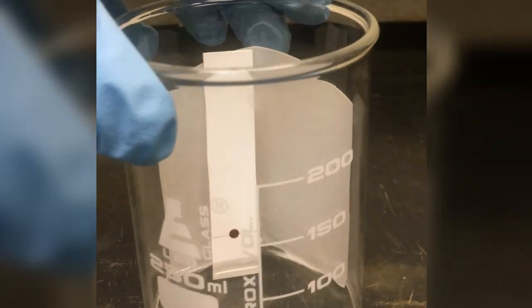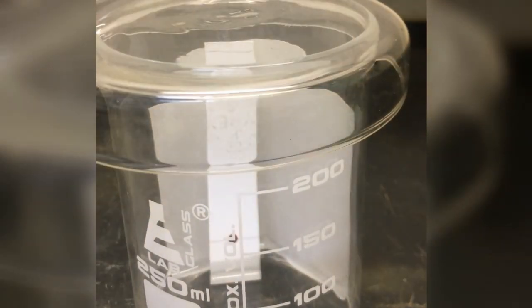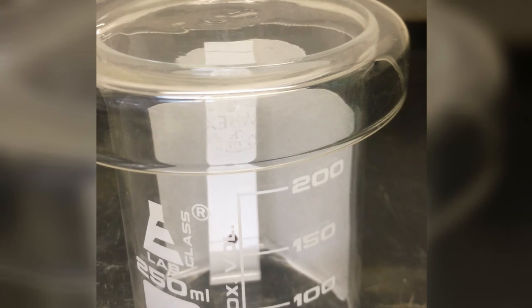It is placed in the solvent and it moves up the paper by capillary action so essentially what happens the solvent moves up the paper taking different components at different lengths until the separation is complete.